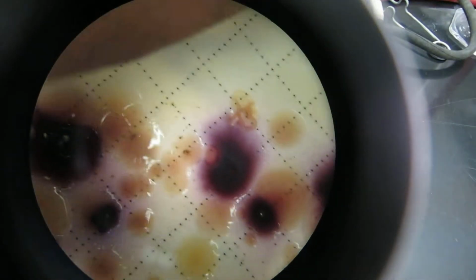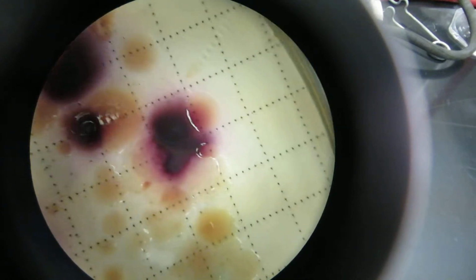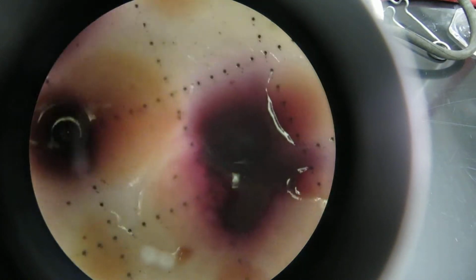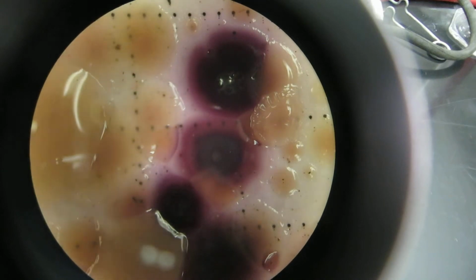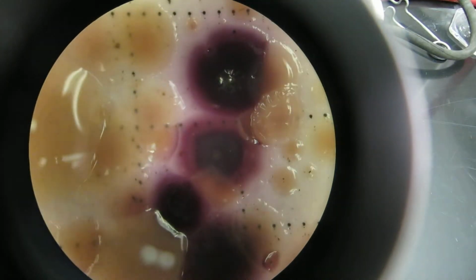Now on this one, it's been in the incubator more than the 24 hours, so some of the colonies have grown together a little bit. You have what's called confluent growth. Two of them that might have been next to each other grew together and formed one. You can make out that this one right here might be 2 or 3 that grew together. And some of these other ones might be just one, like that big round one. Usually it's just one if it's round like that. But if some have grown together, then you'll see 2 of them at the same time. For example, this one right here in the middle might be 2 grown together.